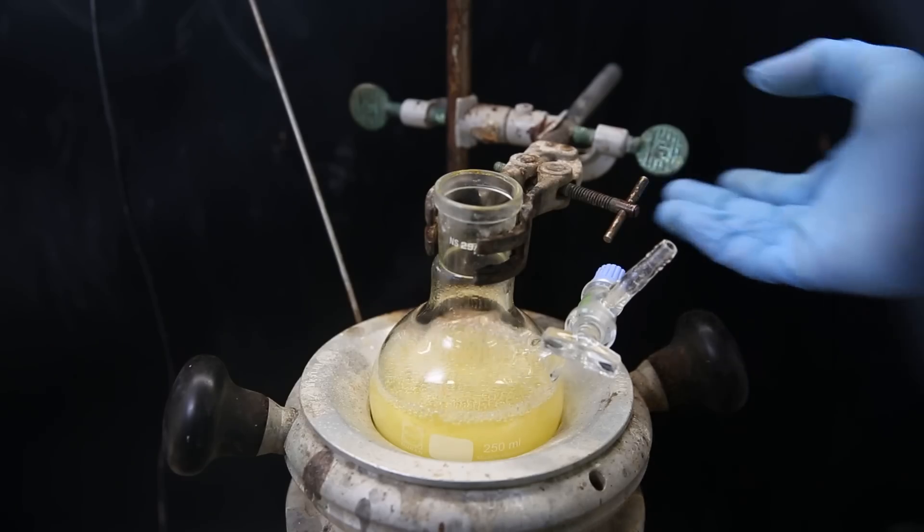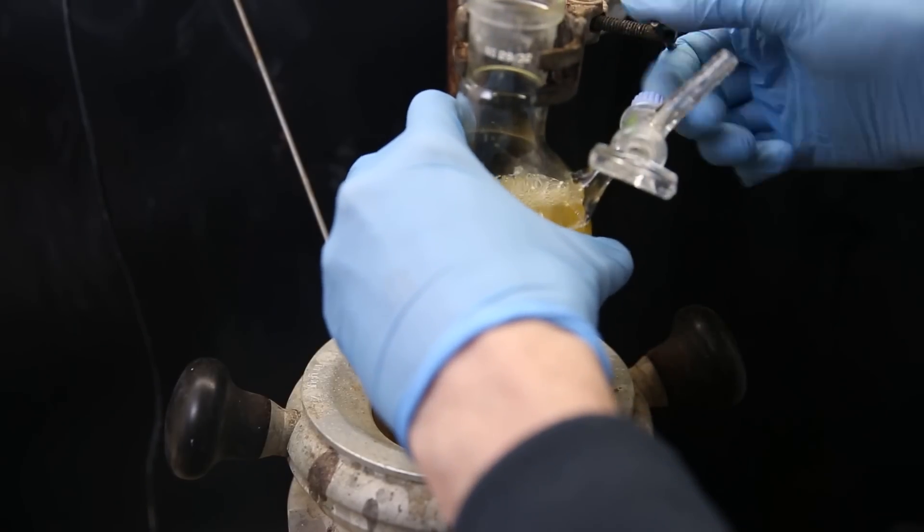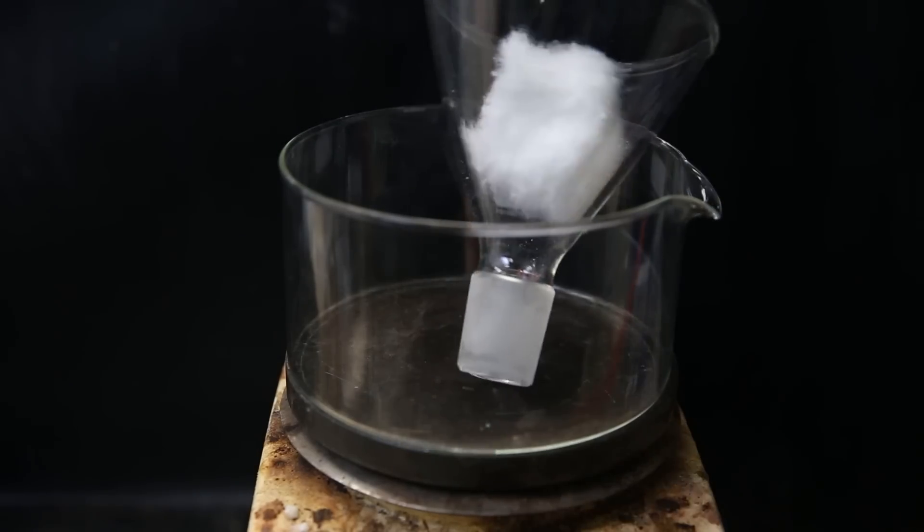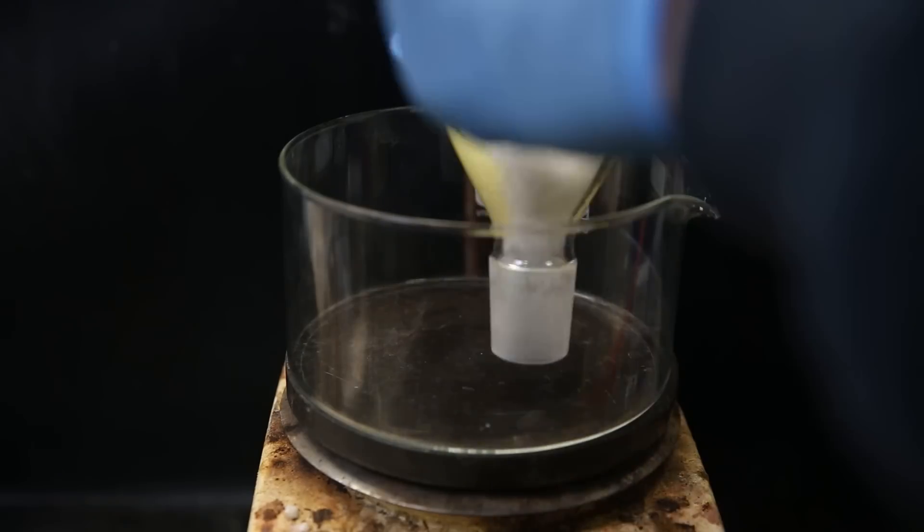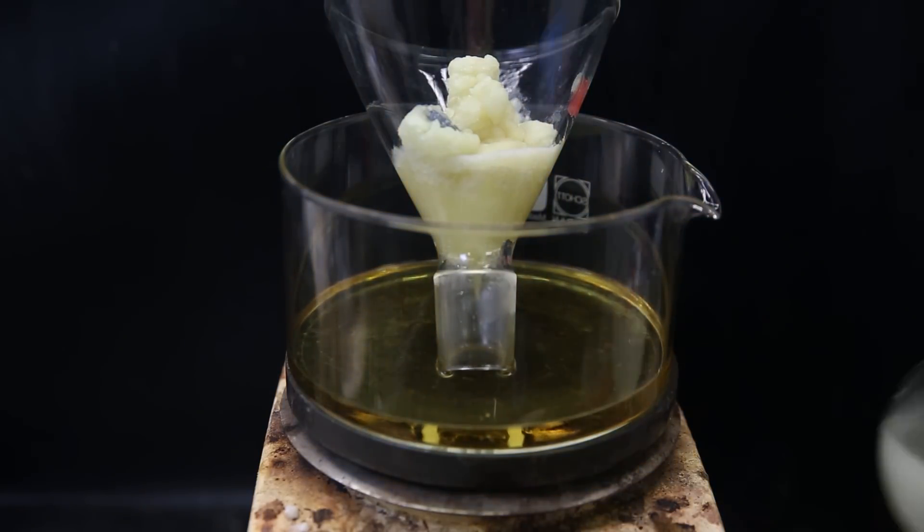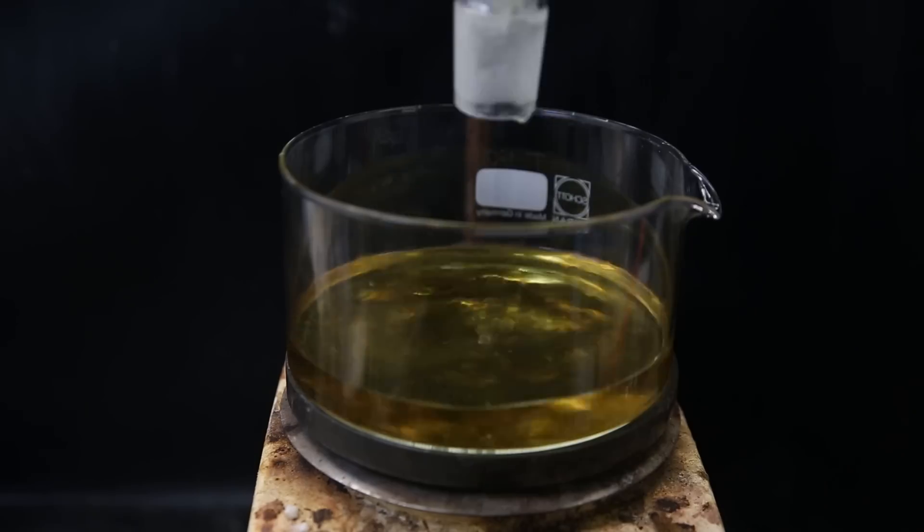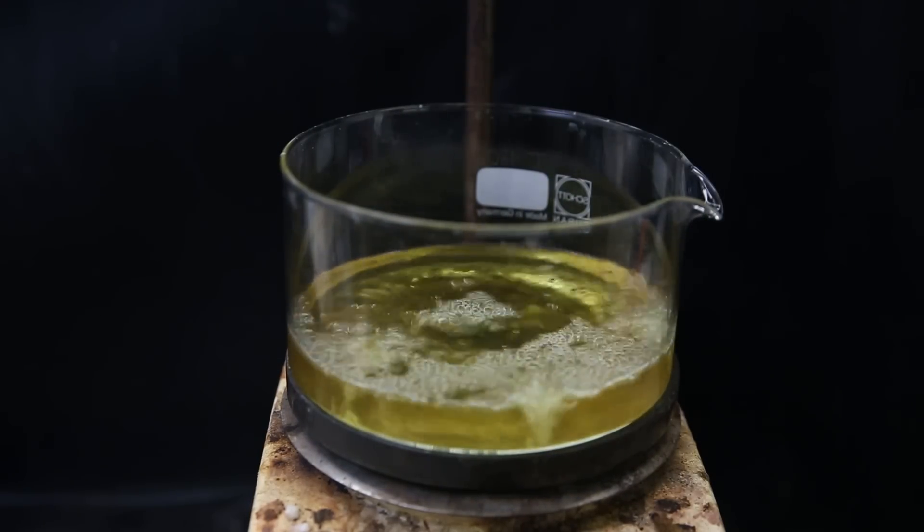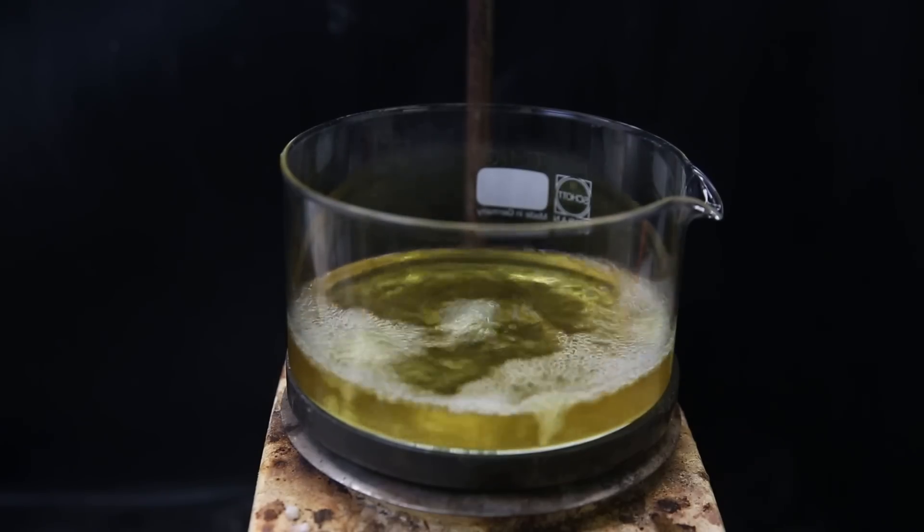When I return, I have removed the condenser, and while boiling hot, I filter the mixture through some cotton to filter out the precipitated 2-fluoroaniline hydrochloride. If desired, a normal filter can be used, and it can then be recovered. I wash it down with more THF, and then boil the solution in this dish for a minute to reduce the volume of THF.